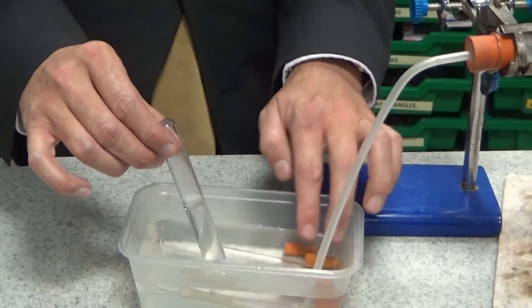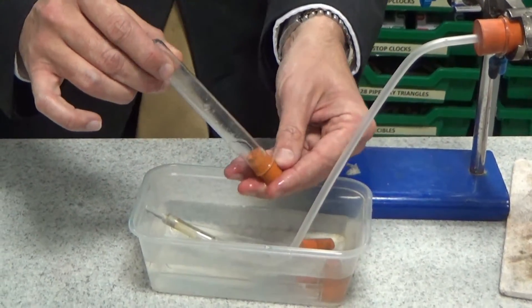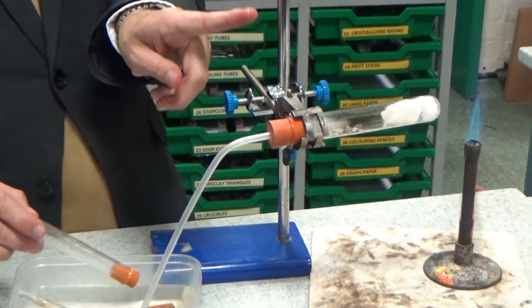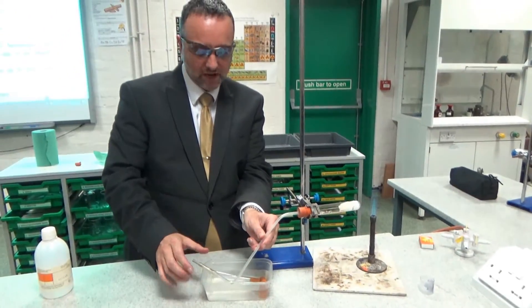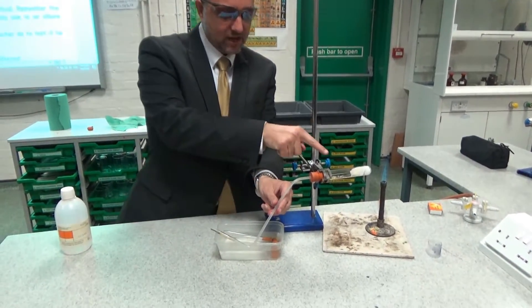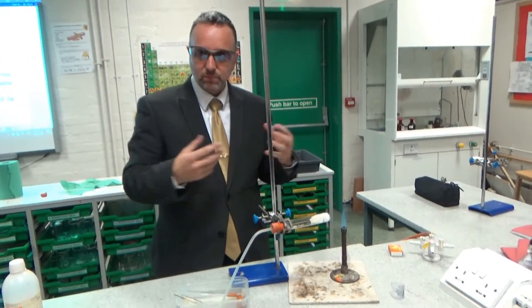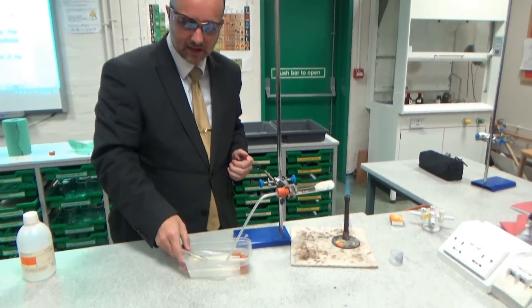When that fills up — which it hasn't yet — so I'm going to cheat a little bit, just let that water out; there will still be some product in there. When you take that away, one thing you must make sure you do is take this tube out straight away, because otherwise as it cools down it will suck the water back in, and that will crack the tube apart and you could get something burning. Paraffin's flammable, so we could get a fire hazard there.